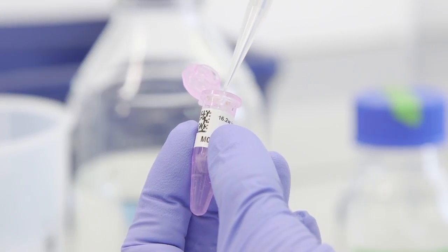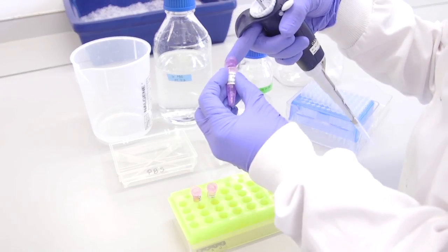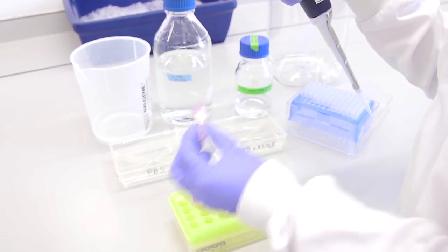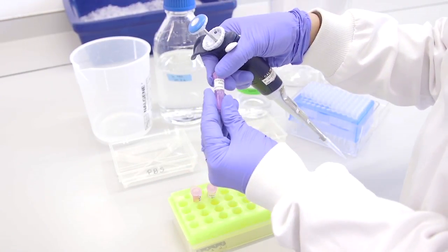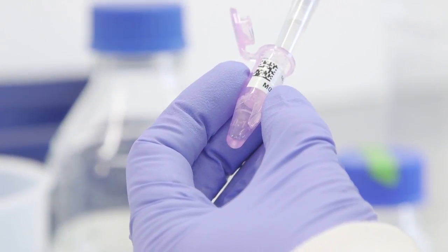Add PBS at pH 7.4 to each tube to wash the sheets. After washing, remove the PBS, taking care to leave the epidermal sheets in the tube as they may stick to the outside of the tip.